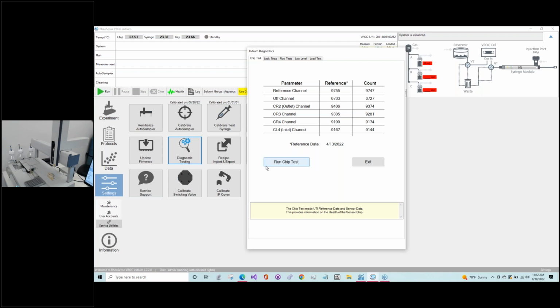So this is where you would get your first warning if perhaps one of the sensors had failed or been blown out due to overpressure, although that's generally not likely on the Initium due to the safeguards that are in place to prevent that, but they can fail over time as they age. So this would be the first place to look for a failed sensor.